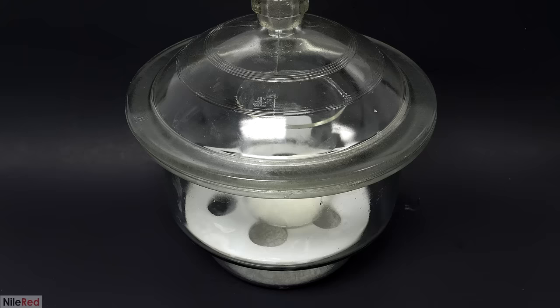Anyway, this reaction had to be refluxed for 24 hours, but after around the hour mark, it visually didn't change very much. This was what it looked like about 18 hours in, and it was just a bit darker. When it got to the 24-hour mark, I took away the heating mantle and I let it cool overnight.